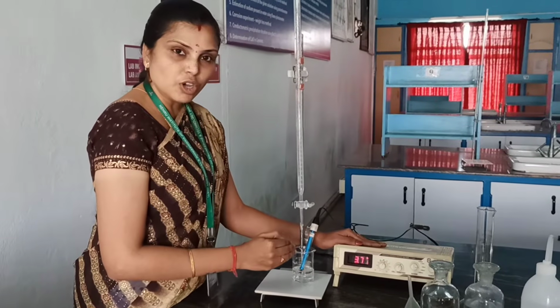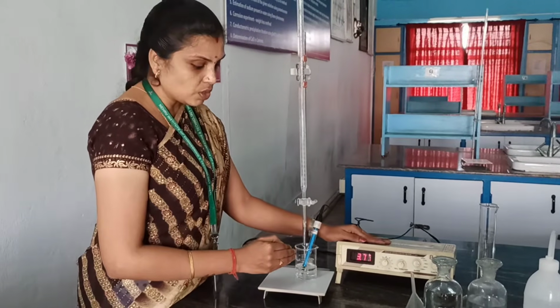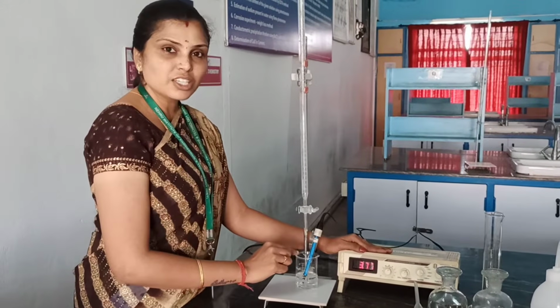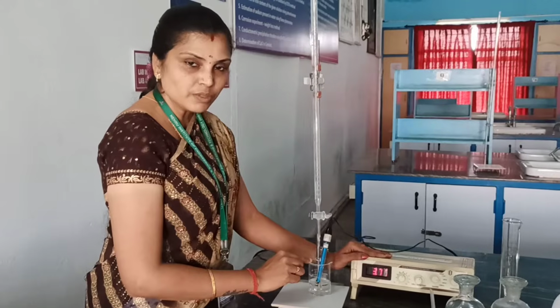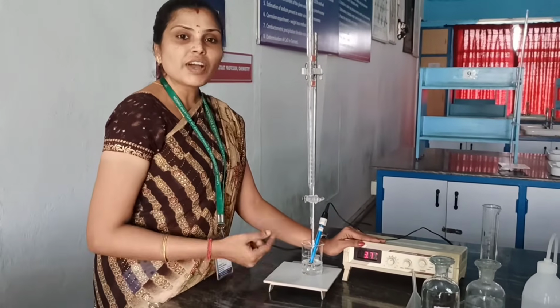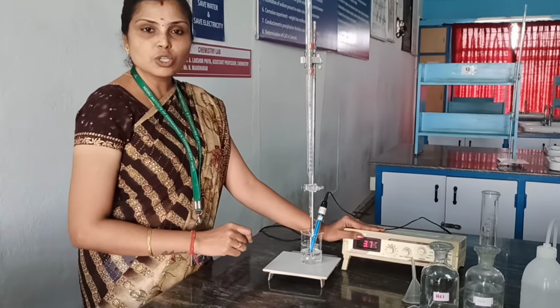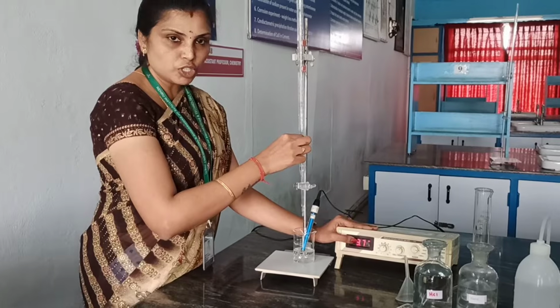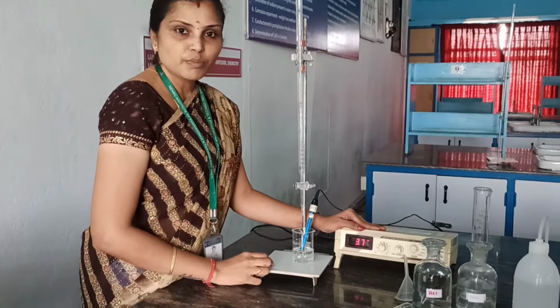While undergoing the titration, you can find that the conductance changes depending upon the number of ions present inside the solution. The conductance will get varied. From the variation in the conductance during the titration, we can find out the amount of that particular solution by plotting a graph between the volume of the burette solution and the conductance measured.